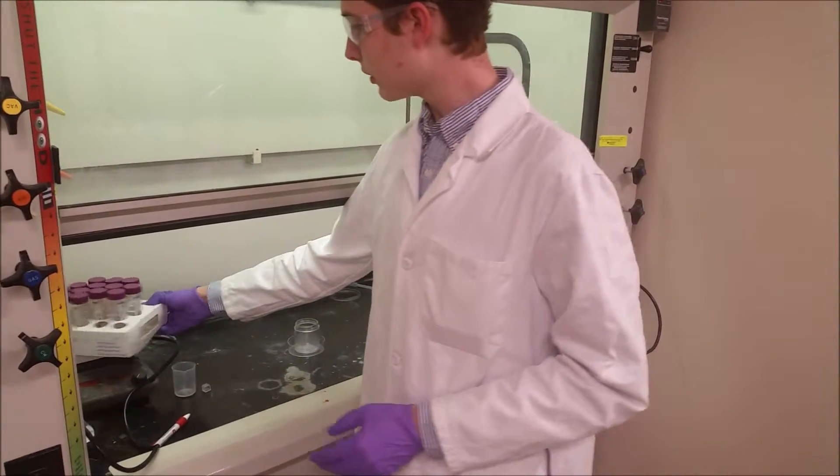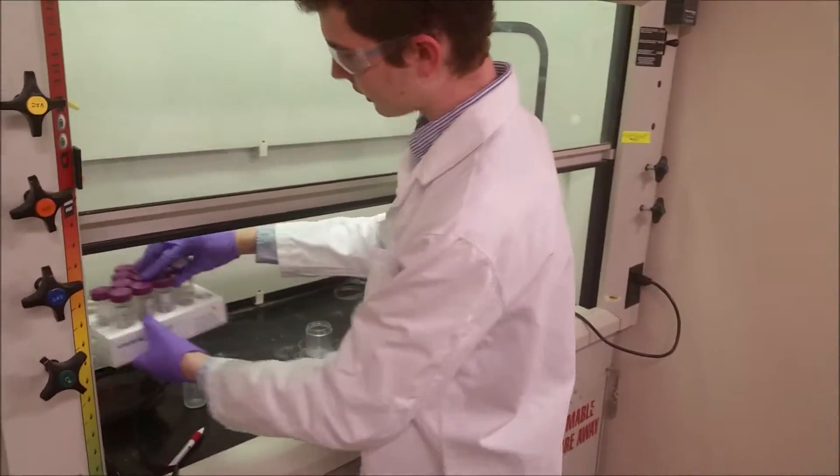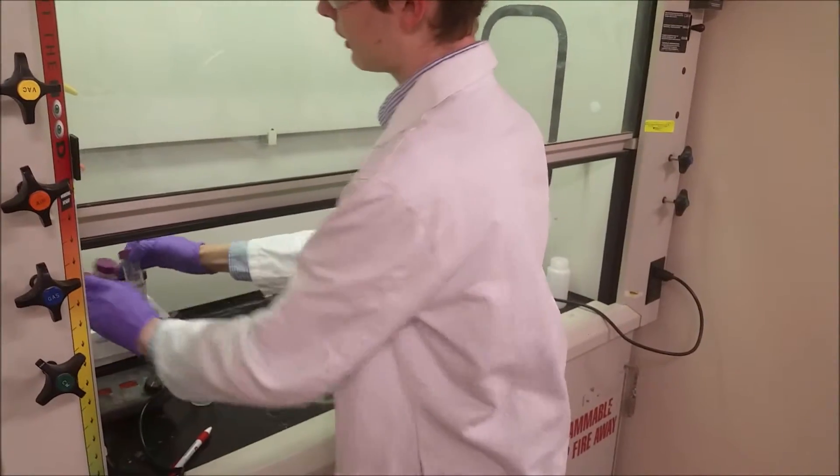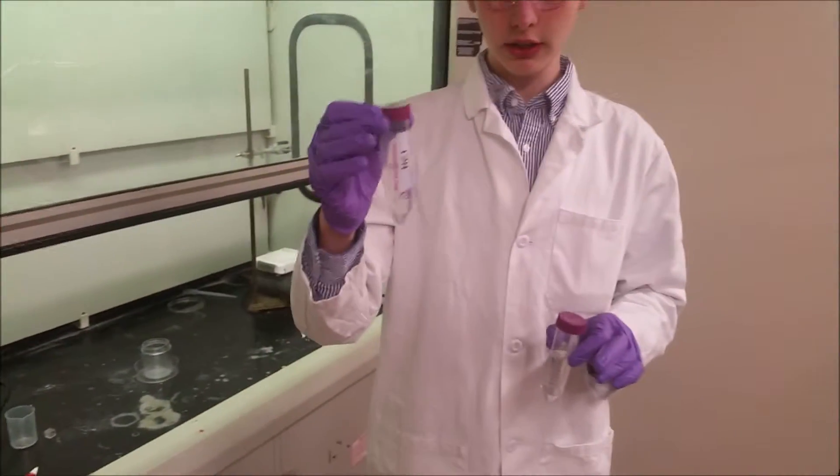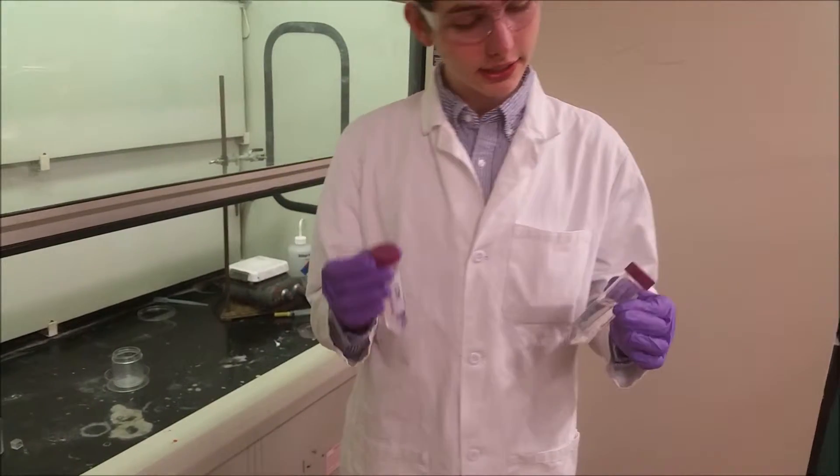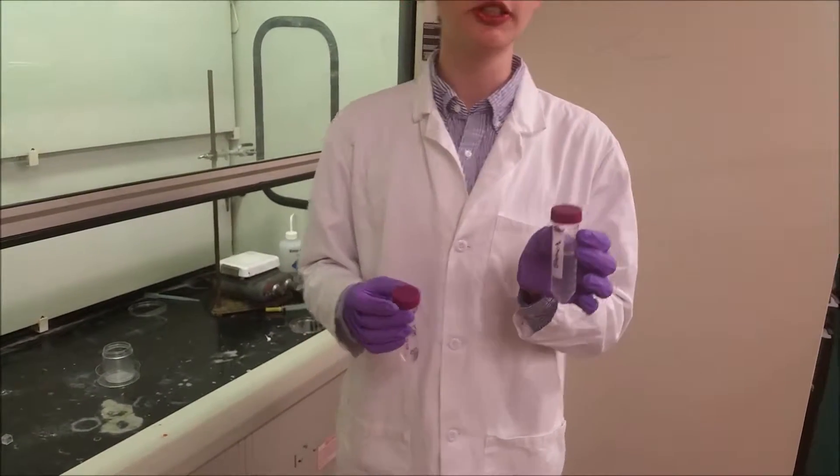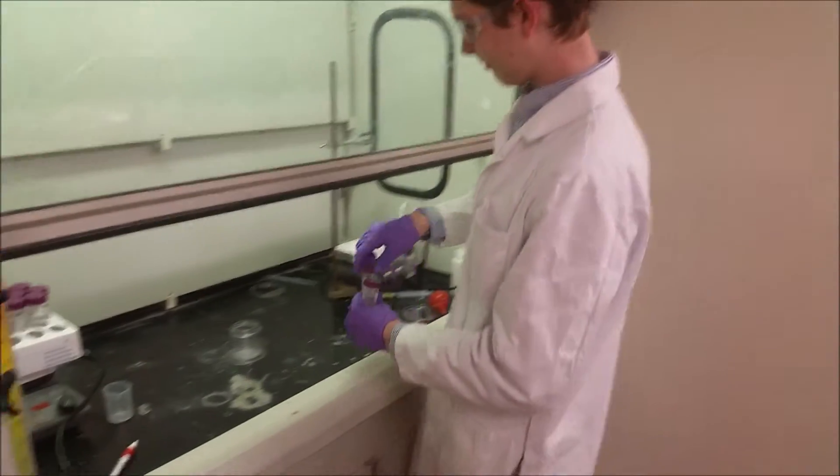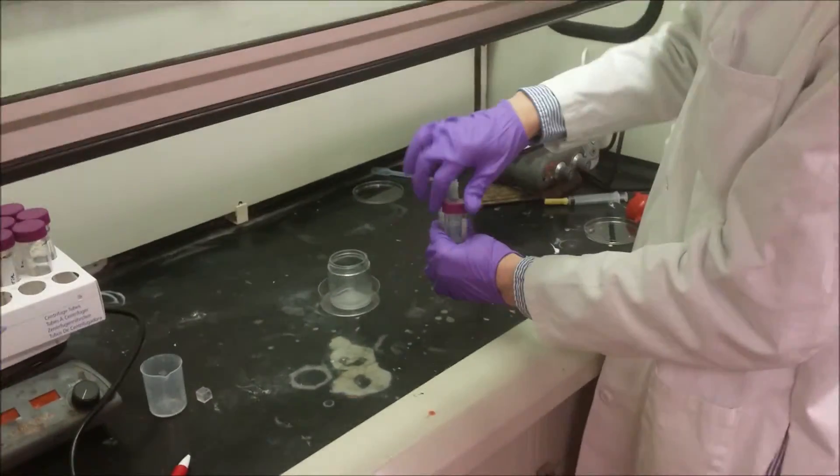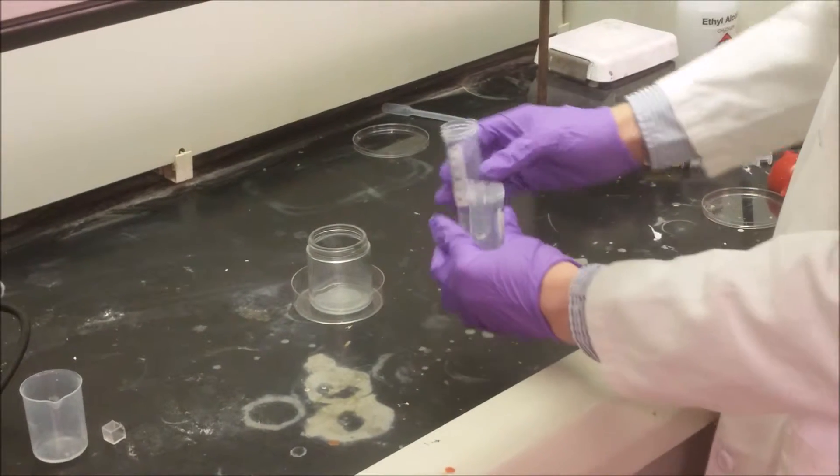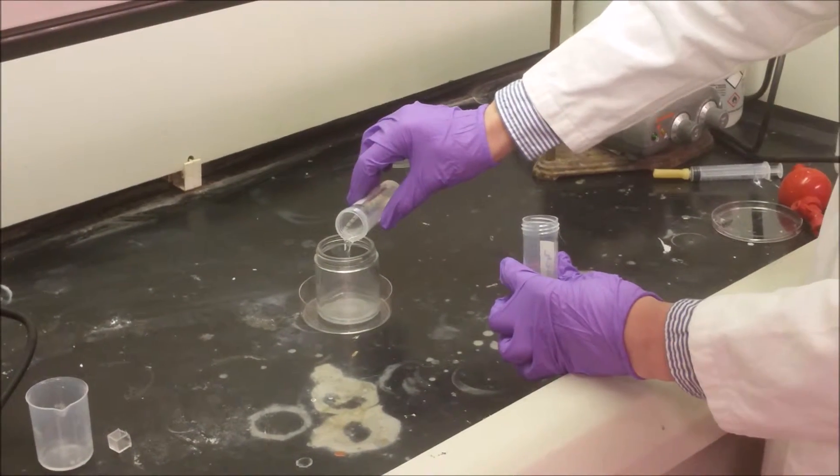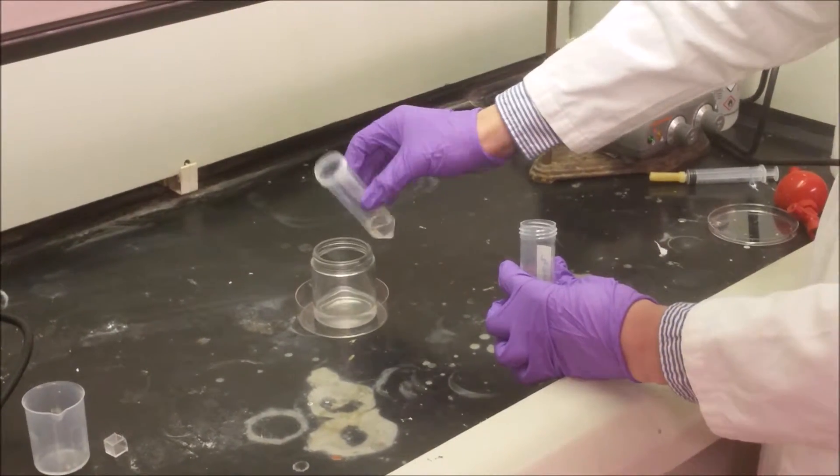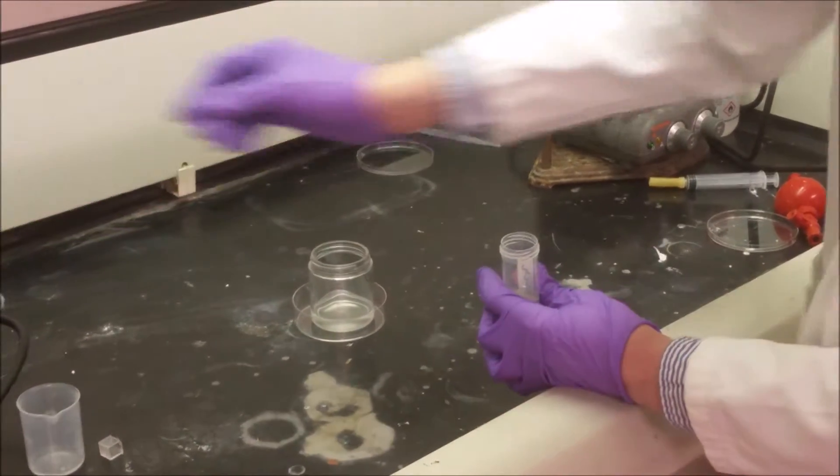We are going to take from this lovely register of tubes, hydrogen chloride or hydrochloric acid, and bleach, which is made up of sodium hypochlorite. We're going to add the HCl first.